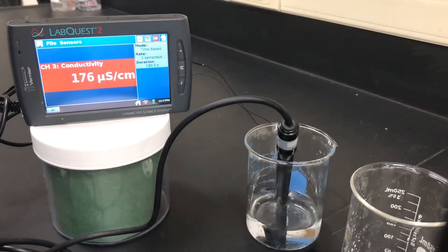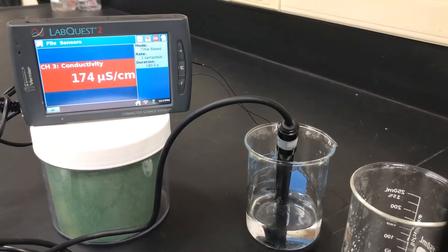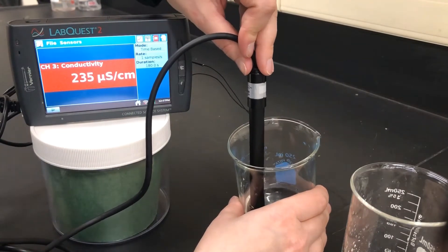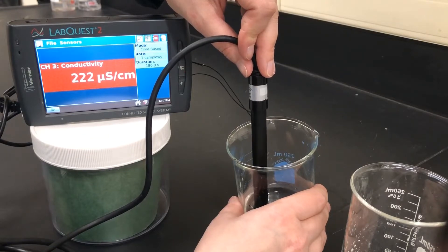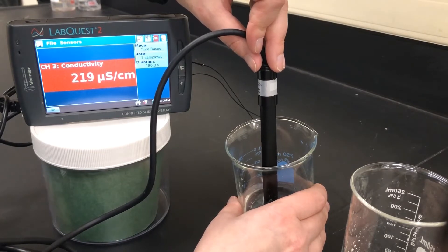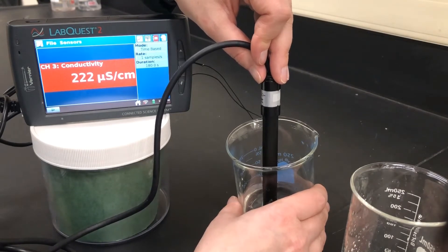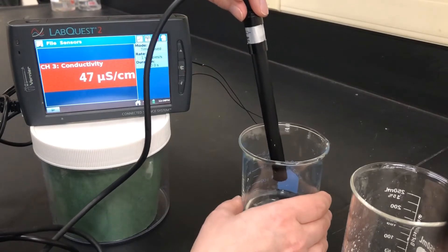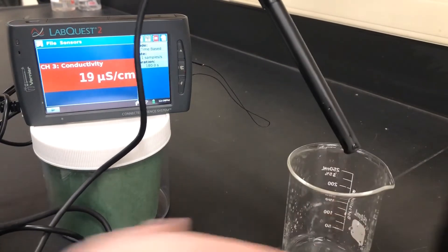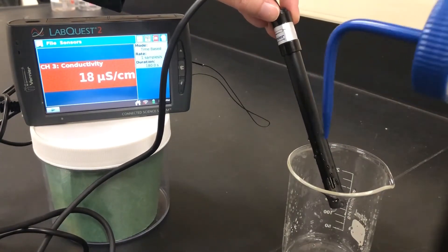This is our last drop of sodium chloride. Give this one last stir and let the number stabilize to measure our conductivity. 222 is our final conductivity reading for three drops of sodium chloride. When finished, this solution is safe to go down the sink. I'm going to use my waste beaker and DI water to rinse off the probe so the next experiment is not contaminated.